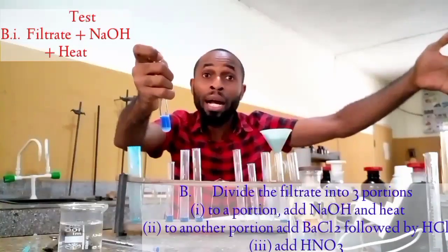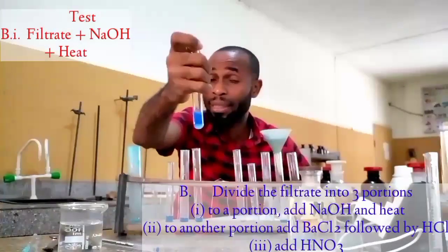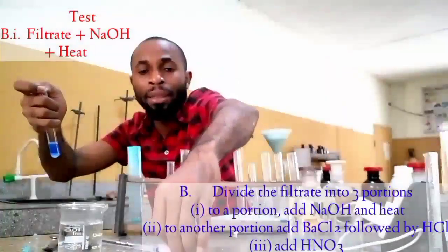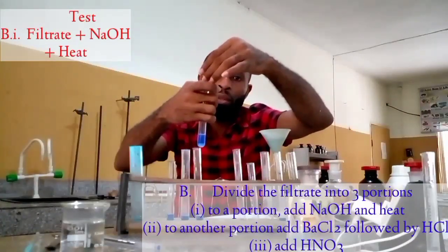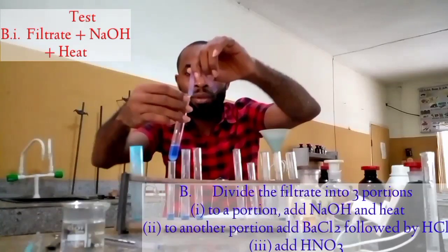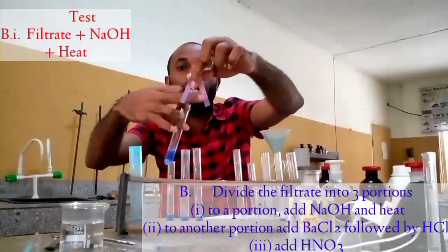Whether it is your burner or your gas, it works the same way. Now, if you try to smell this, you're going to perceive a choking smelling gas. Now, if I bring my litmus paper close to this, I'm expecting to get a color change. This was red and it became blue. This was red and it became blue.